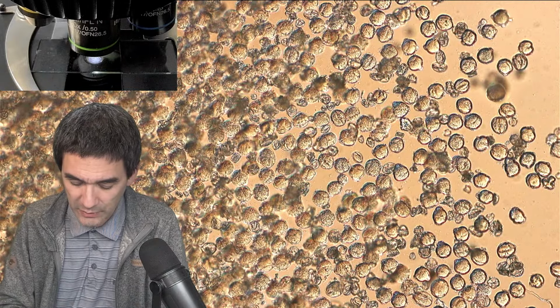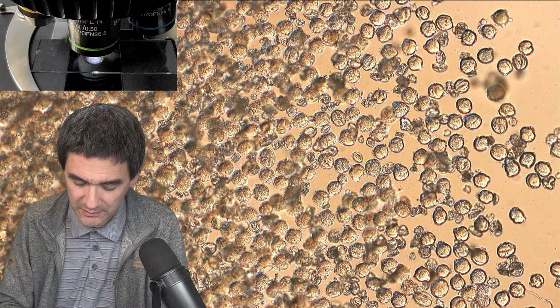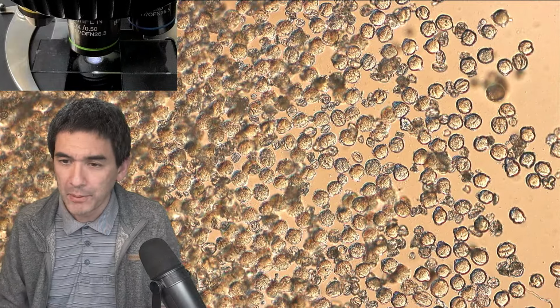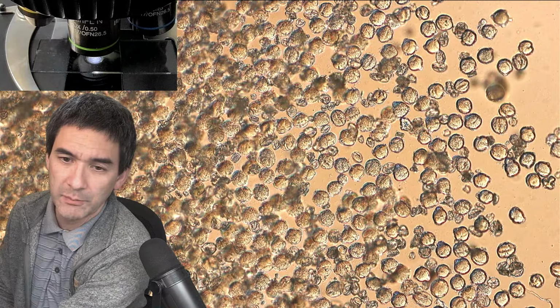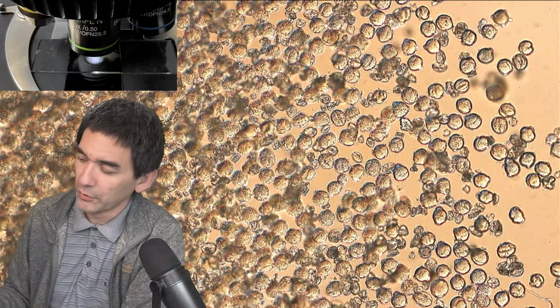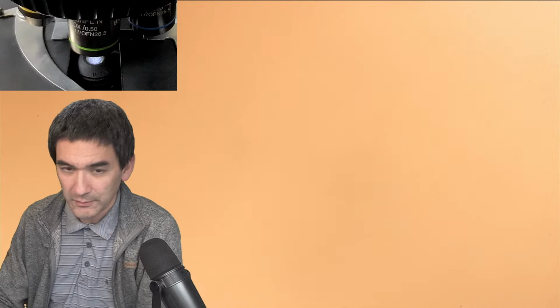When I'm going to add a cover glass, does the BX53 beep when turned on? Let me try. Off. Yes, it beeps. I don't know if you heard it. It makes a tiny beep when it's turned on. Did you hear that?